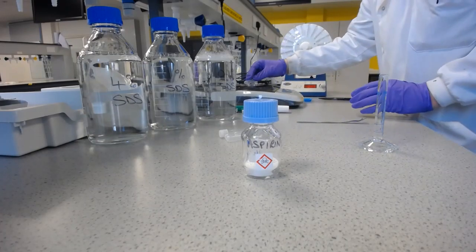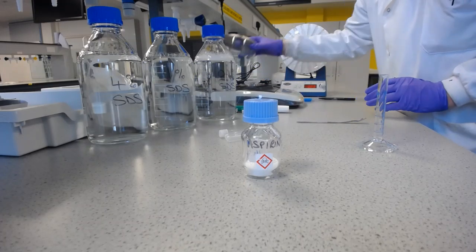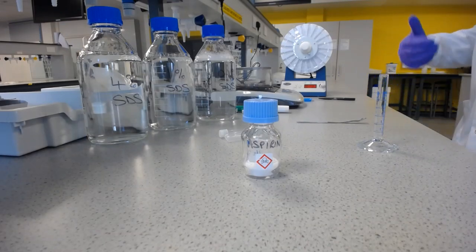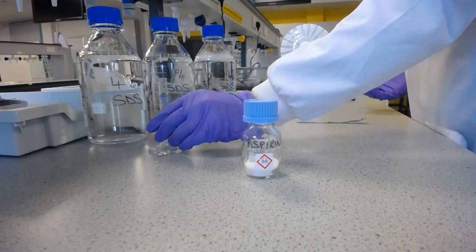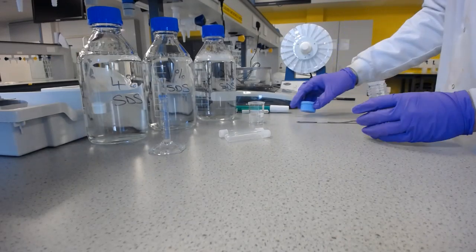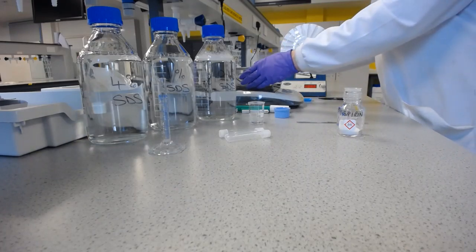What I'm going to do is put my plastic tube, actually with the lid, on there centrally, and then tare or zero the balance with that on. This means that I can weigh directly into the tube, and I don't have to worry about losing any of my mass when I transfer between a weighing boat, for example, and to the tube. And looking at the script we've got, I'm going to put 200 milligrams of aspirin directly in there.